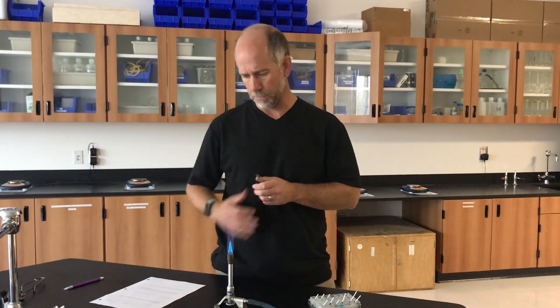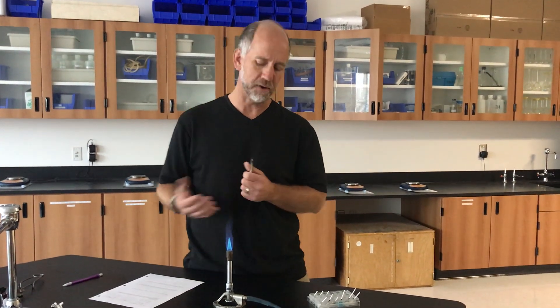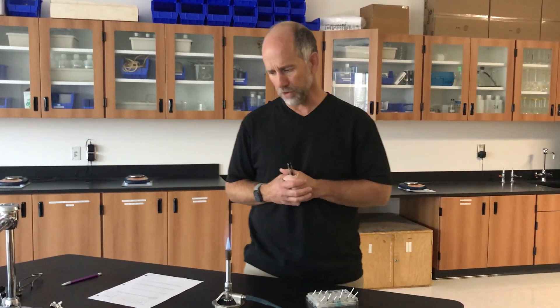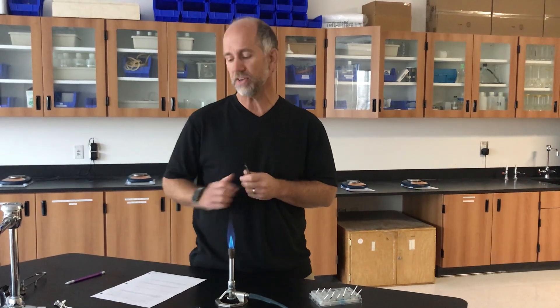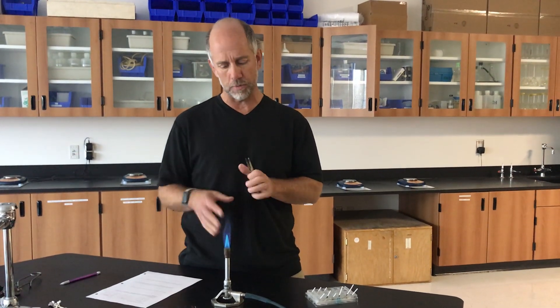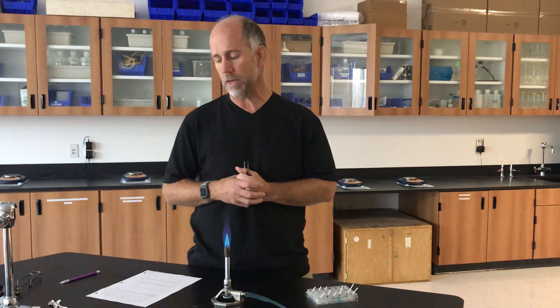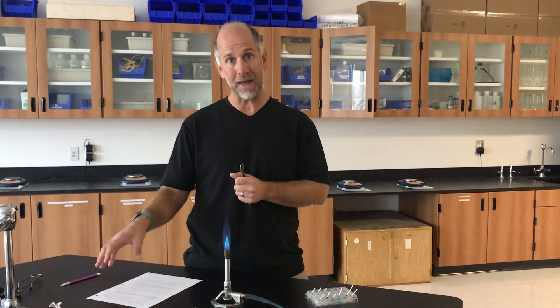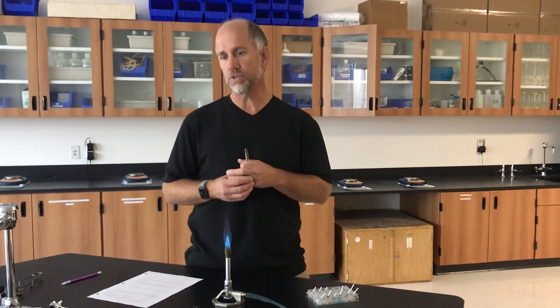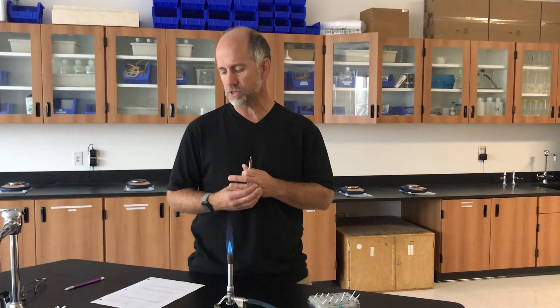Turn your lab over or go to the second page. You'll notice on the back it says unknown A, B, and C, and there's a place to write down the colors that you observe when we flame test these. Notice off to the right, you're being asked to identify what metal these unknowns contain. You'll do that through comparison.